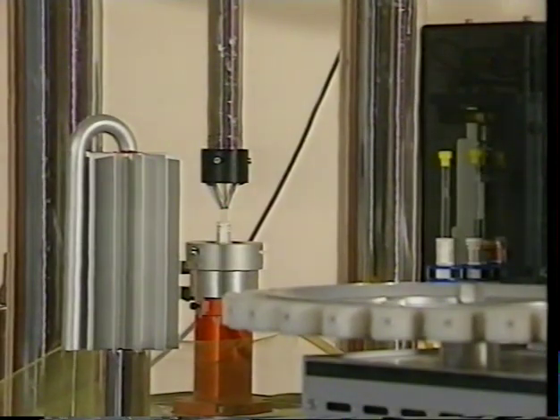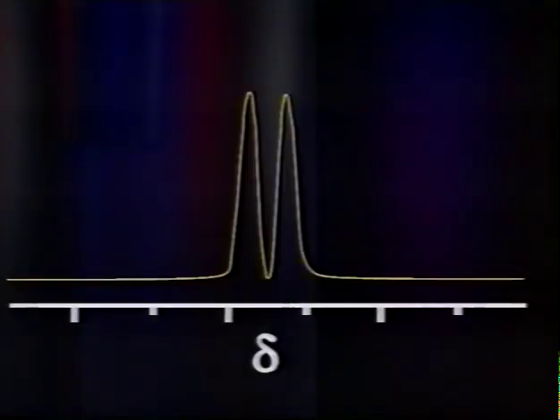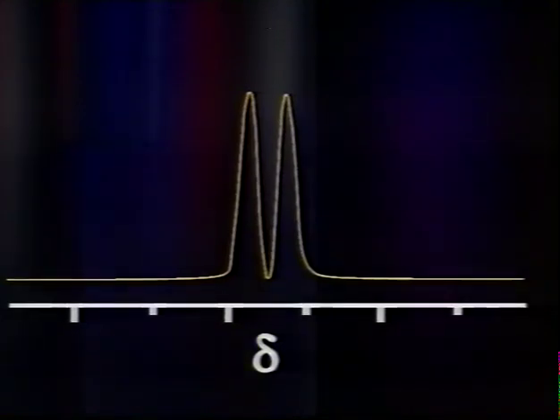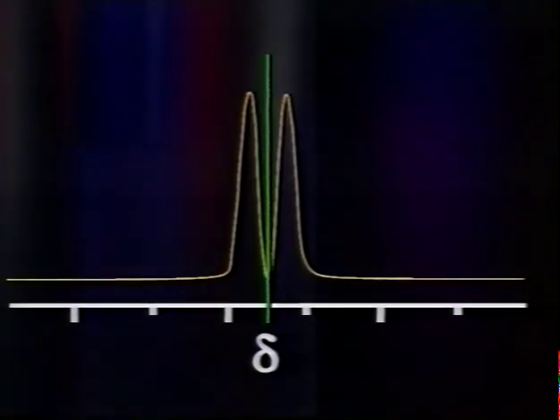Because of the vast numbers of molecules, and therefore protons, in an actual sample used in a spectrometer, both possibilities are bound to be present. So the resonance shows as two peaks, a doublet, on the spectrum, and the center line between these two peaks is the position of the chemical shift.